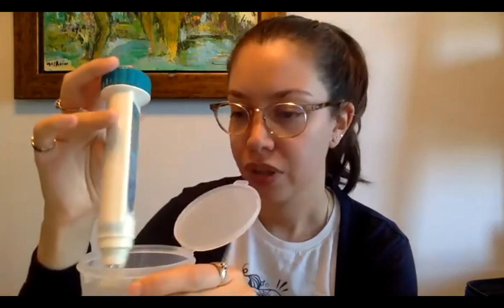So when you test quite regularly and you note those environmental conditions, you're going to be able to see whether this conductivity is coming from just a storm or a large rain, or could it be due to pollution, or what could be affecting it? Okay, so I have my reading. It's 278 and 23.1. I'm not going to write it down, but you should write it down either in your app or in your little booklet.